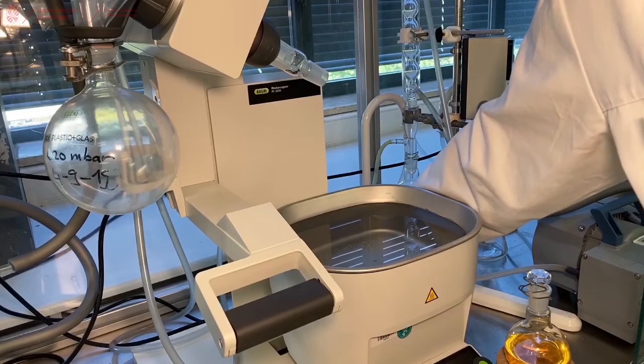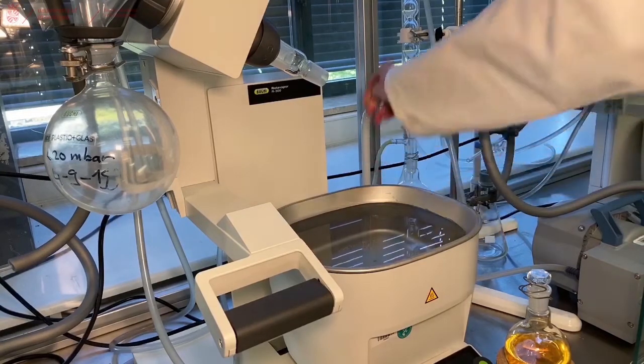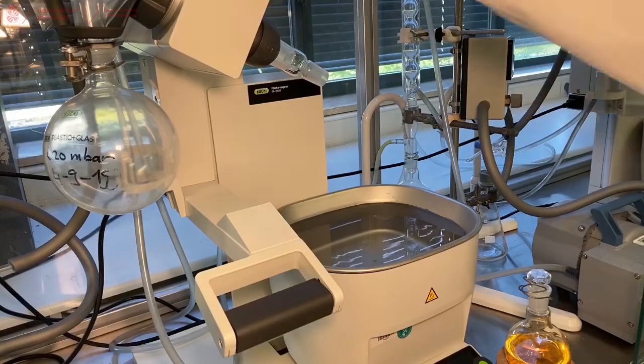You should hear the water running, it should just be a slow trickle to the Rotary Evaporator and that will cool down the Rotary Evaporator.